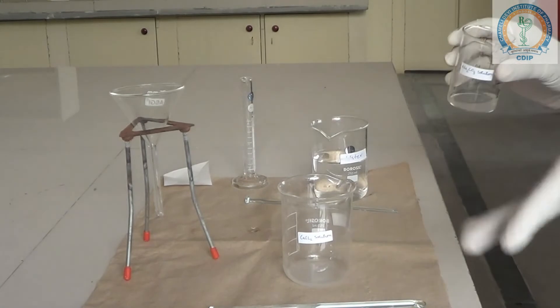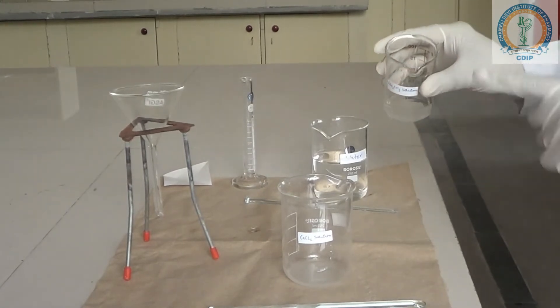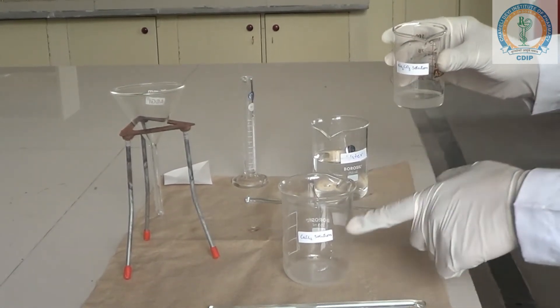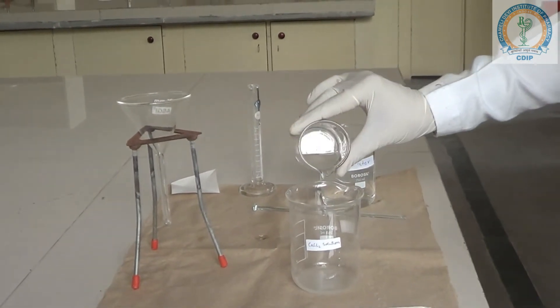Now, we have to add drop by drop sodium carbonate solution to the calcium chloride solution. Now, let's see.